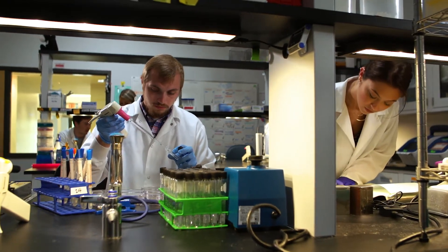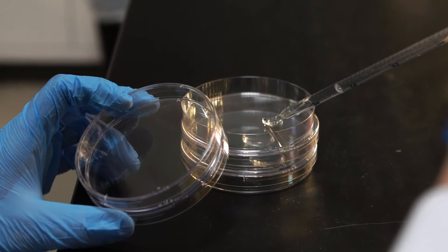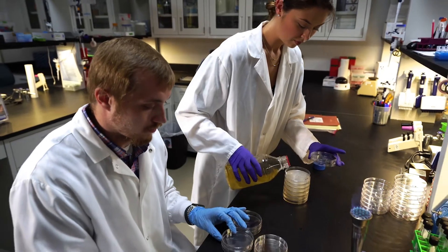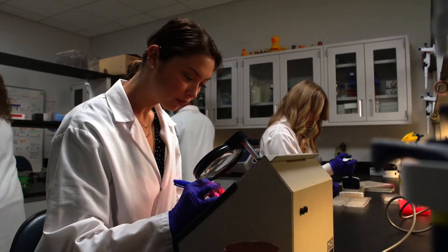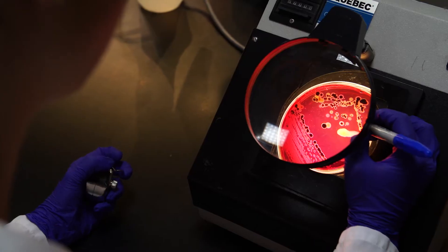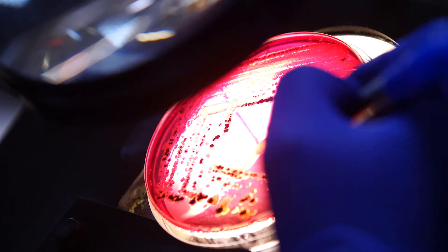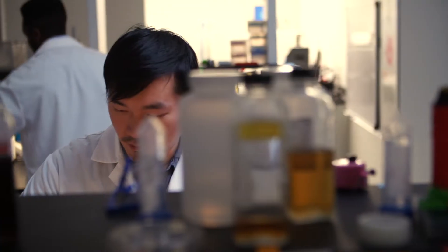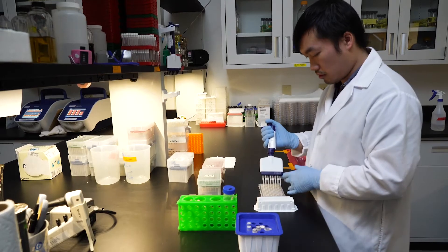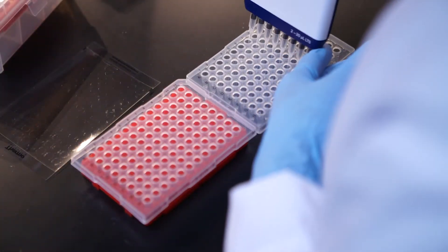After arriving at the lab, the samples are processed and plated on agar media to culture and count E. coli and Clostridium populations. Representative colonies from each sample are picked and the DNA is isolated to further confirm the identity and type of the bacteria.